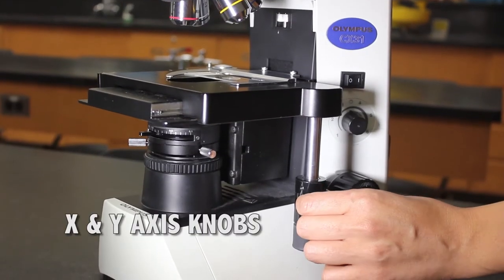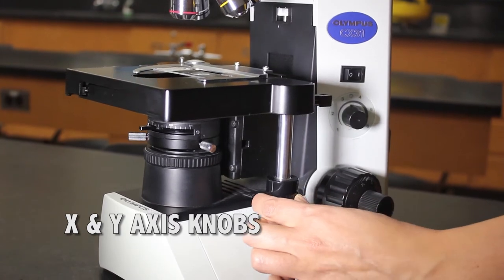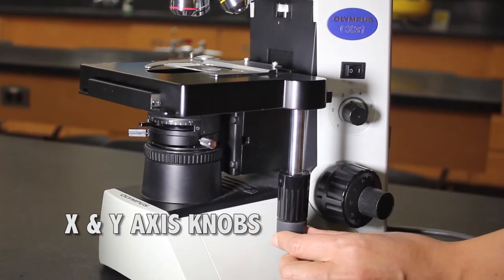Stage X and Y axis knob will move the slide forwards, backwards, and side to side.